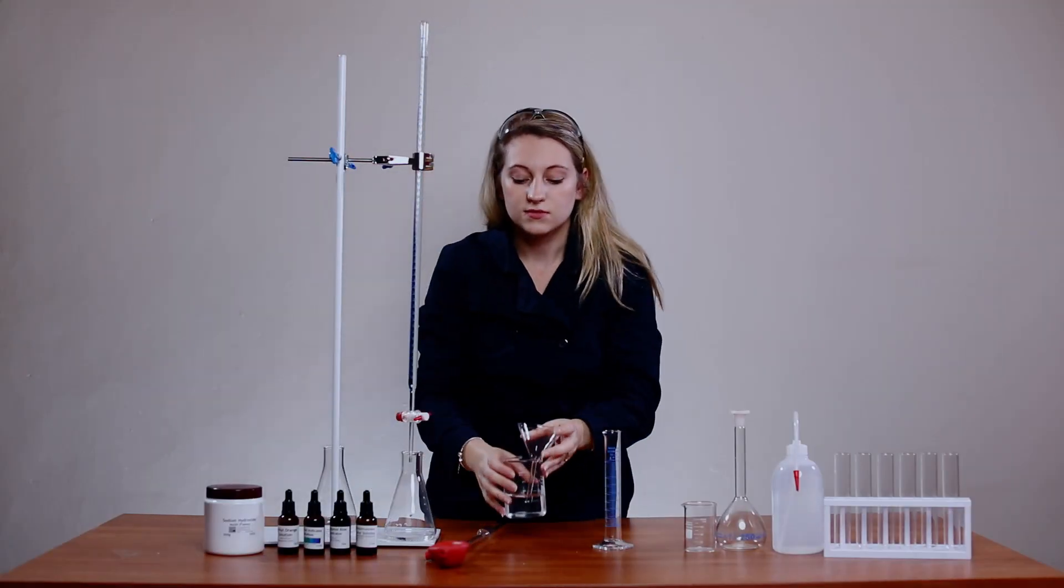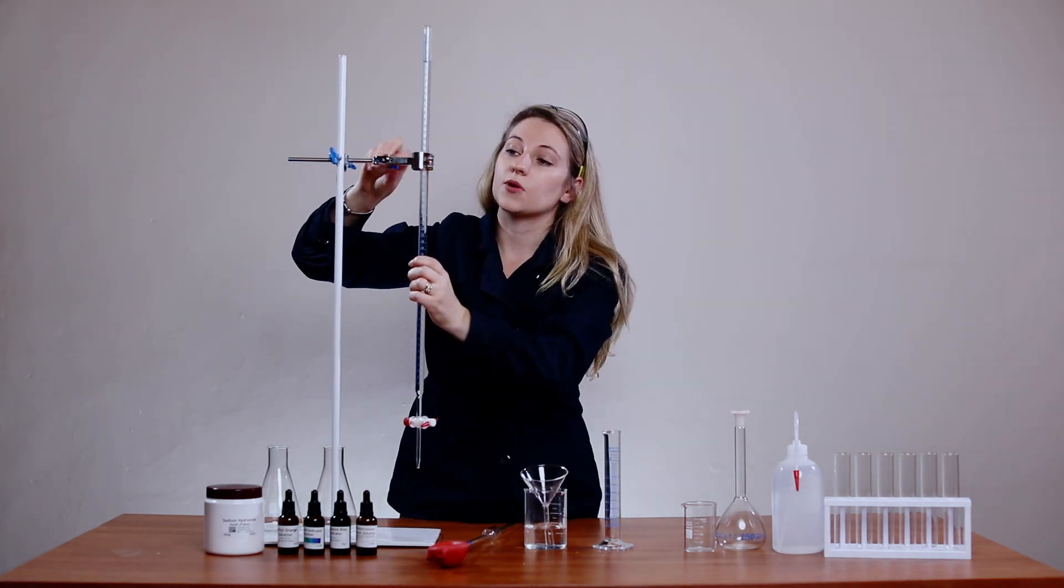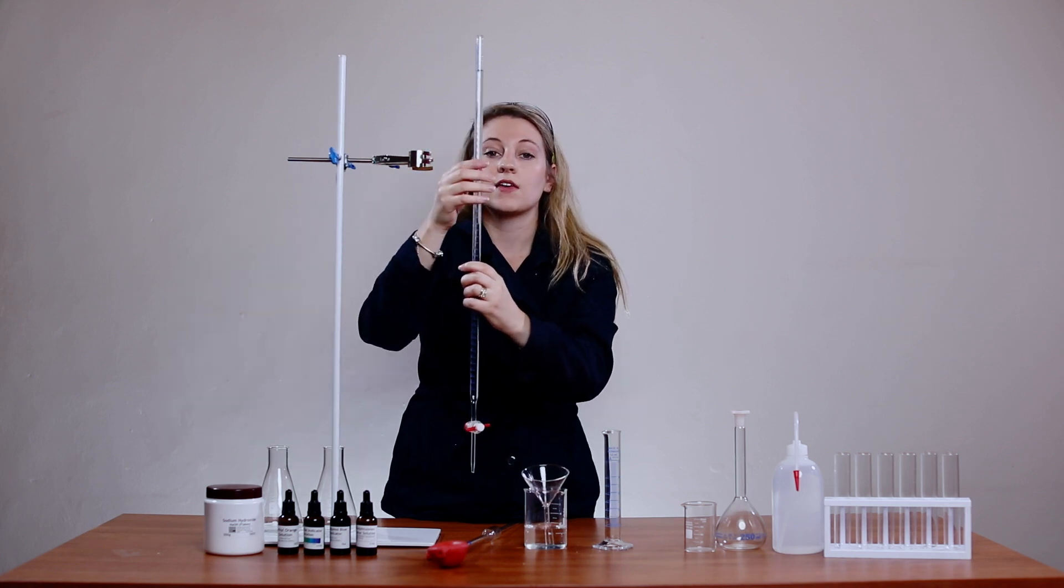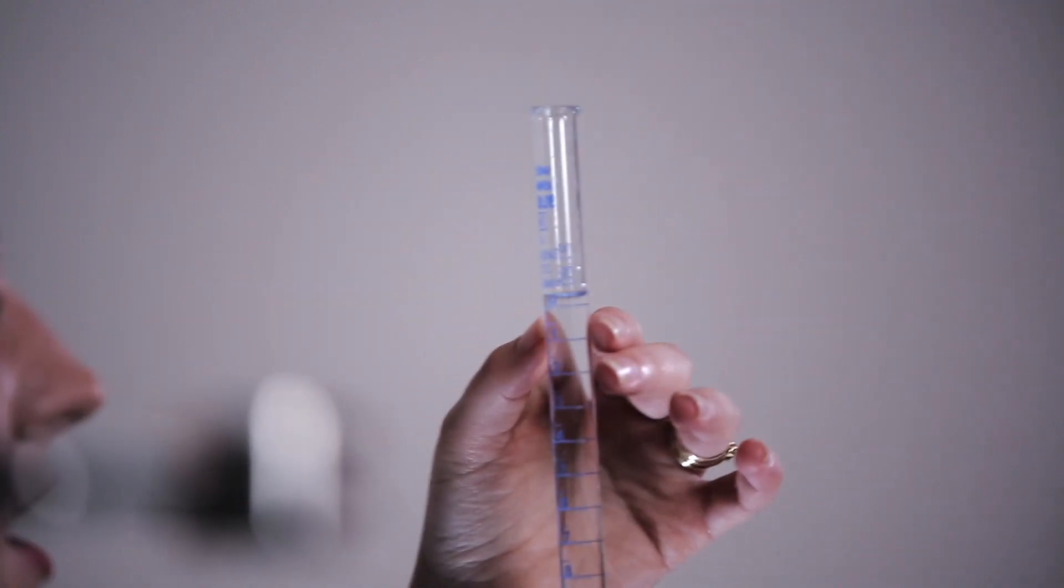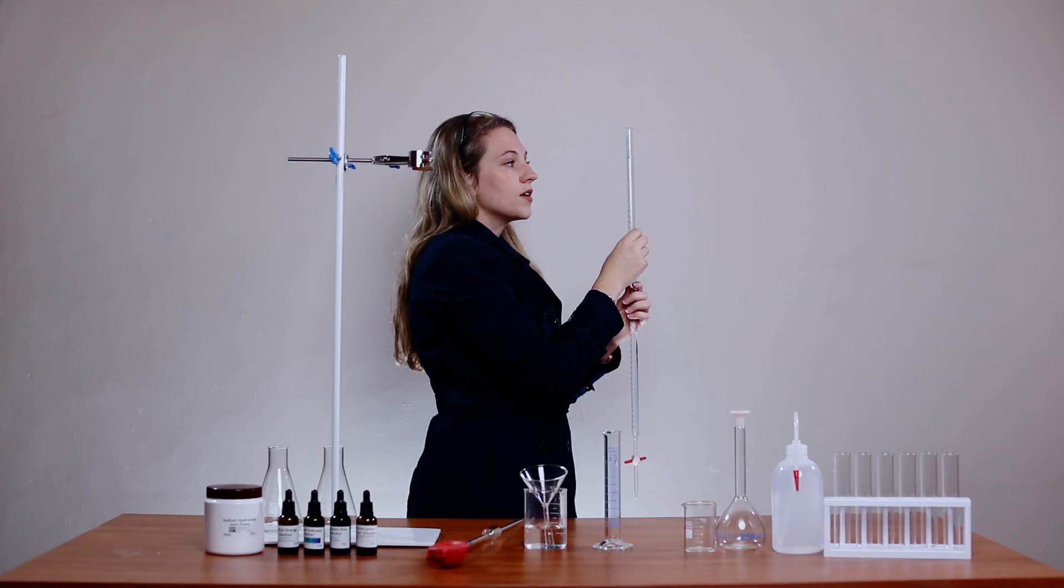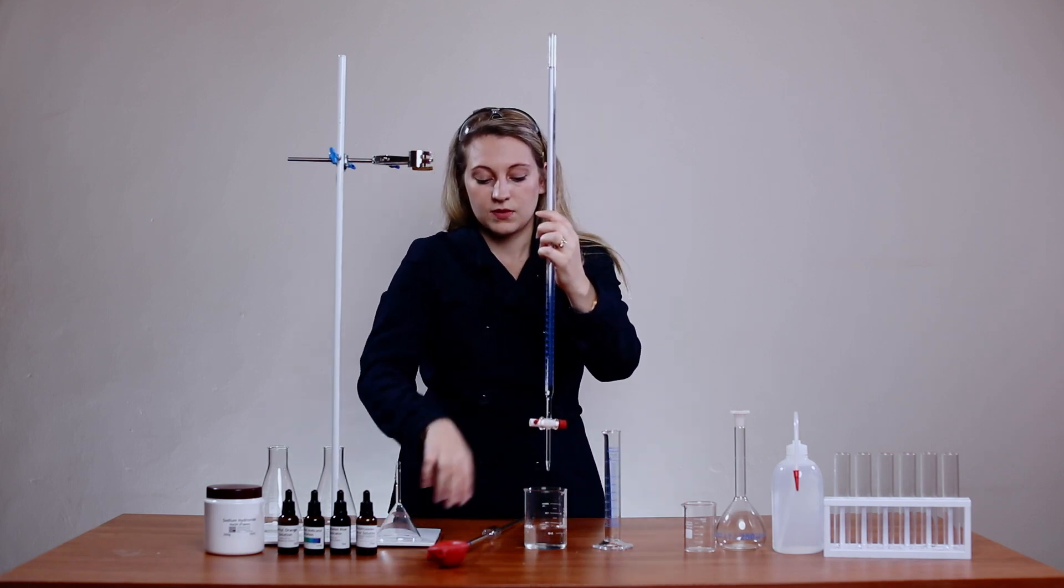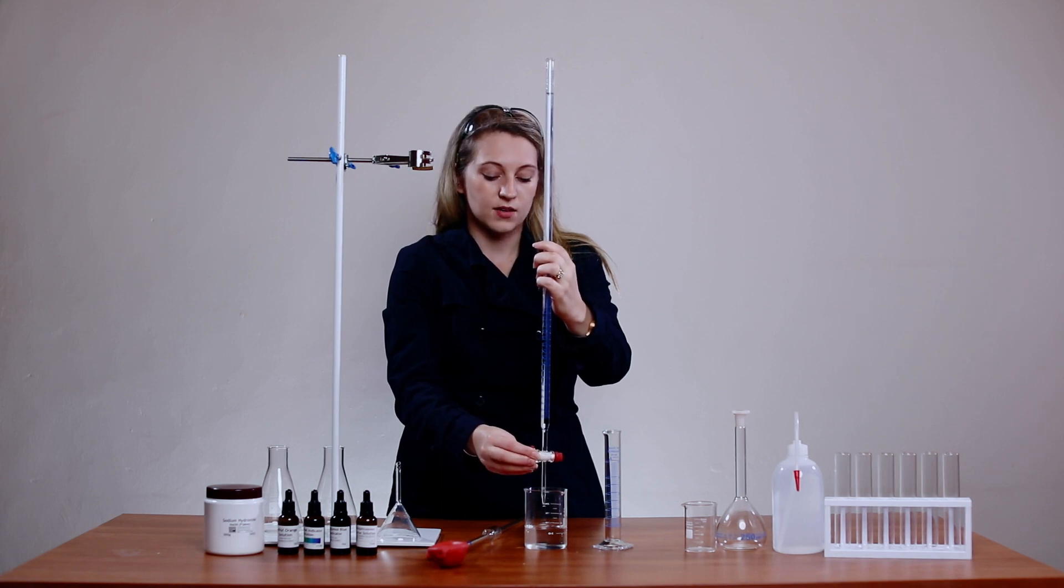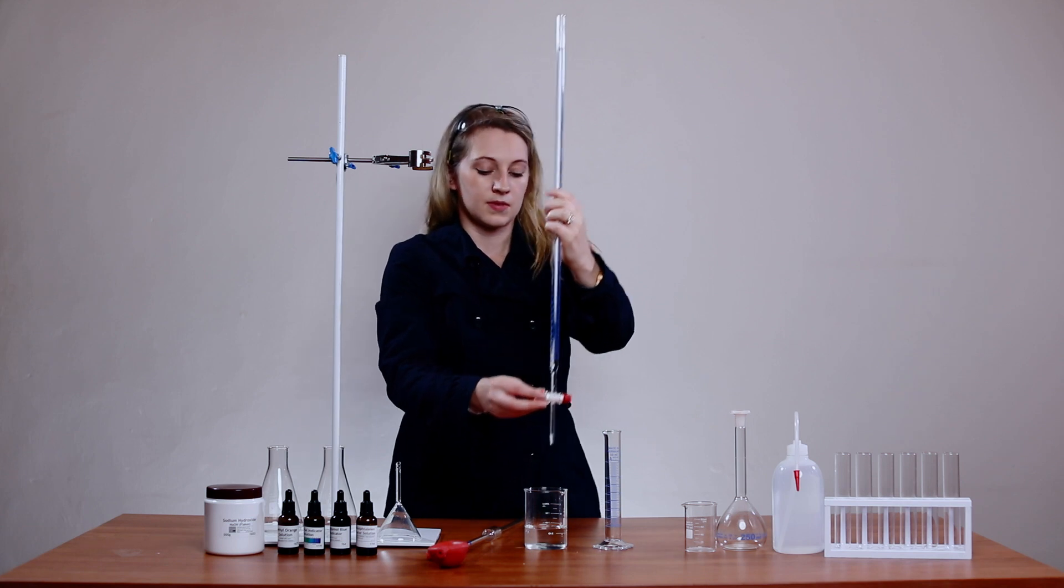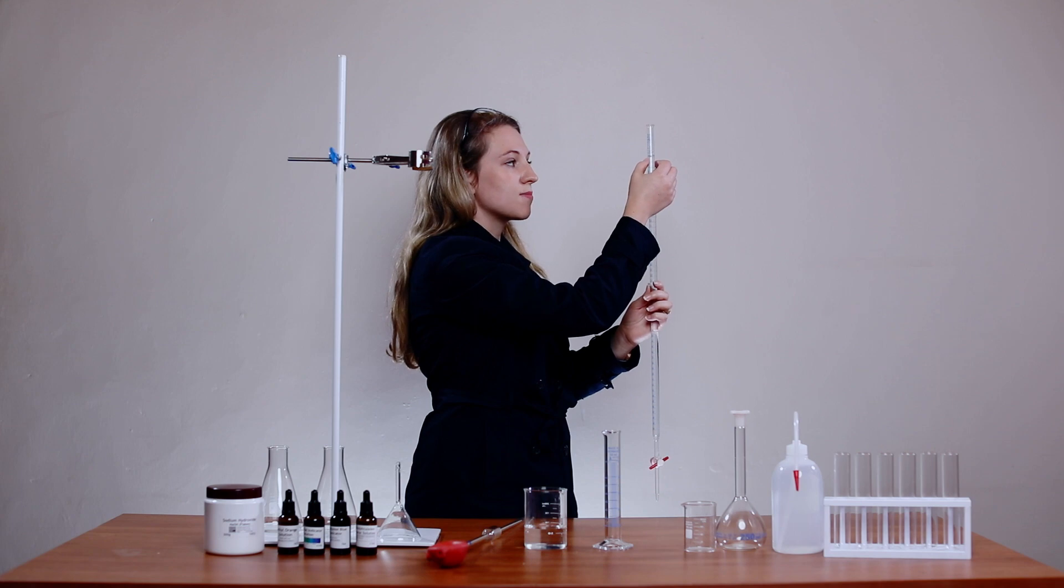If you're not sure if that's exactly zero, you're going to have to take off the burette, look at the reading perpendicular to your eye to ensure that the meniscus is exactly on your eye level. In this case I've got one or two drops too many so I'm just going to open my tap again to get that last little drop out to ensure that my meniscus is where it should be. That's basically perfect.